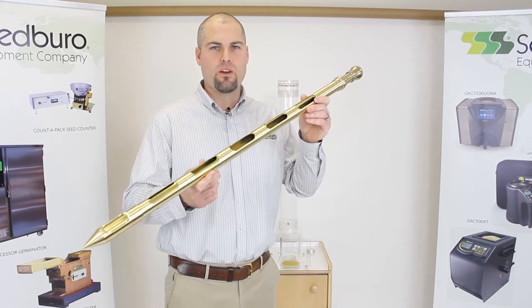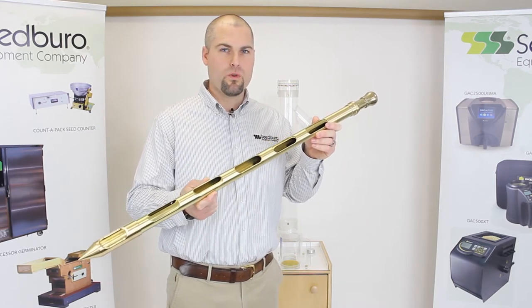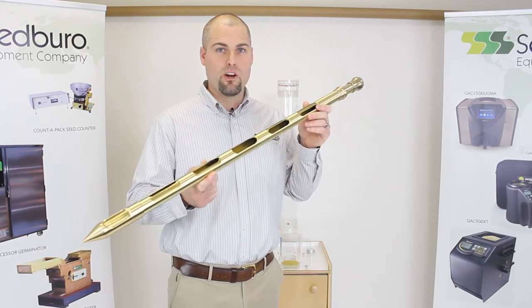The first thing we recommend is to take a representative sample with some sort of sampling device like our grain probes.